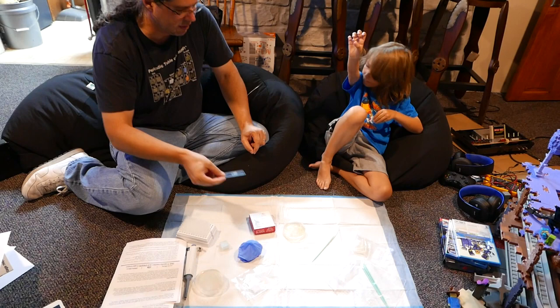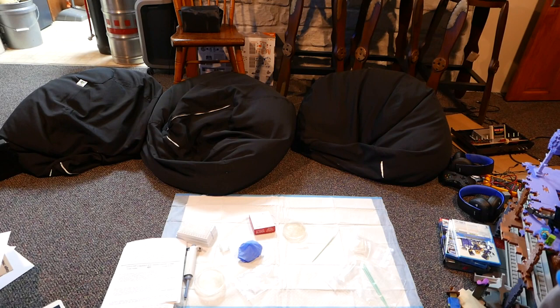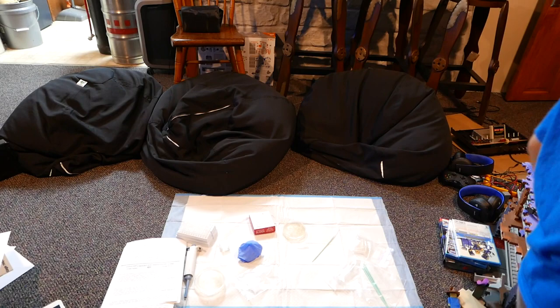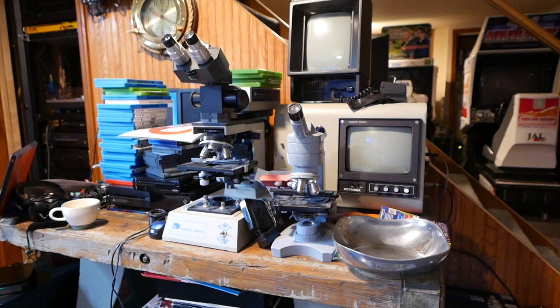What do you think it is? I don't know. You want to hold the camera while we're doing this? I thought we should turn it over. Like this. Hey, I was supposed to do that. Hold on, stop. I think we're good.